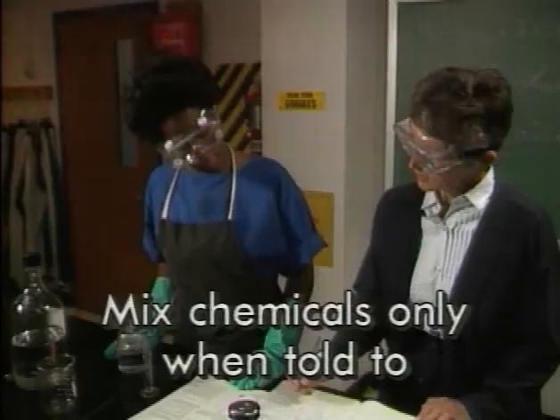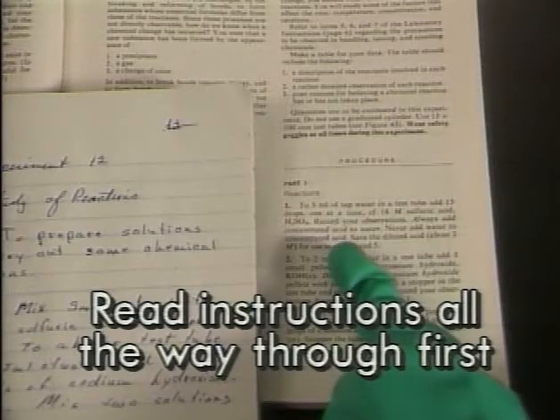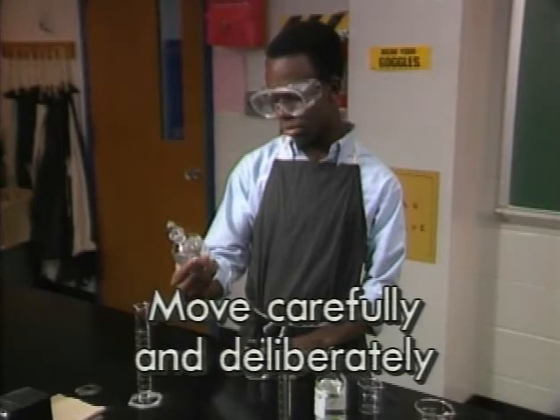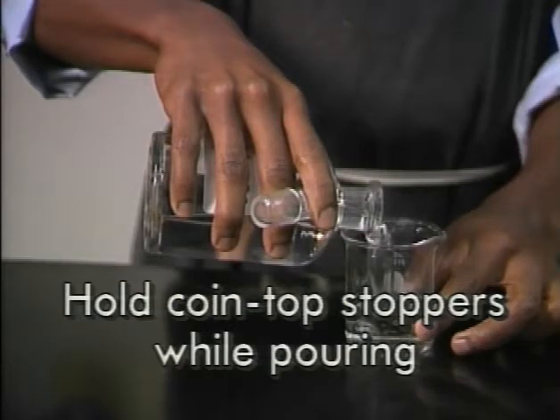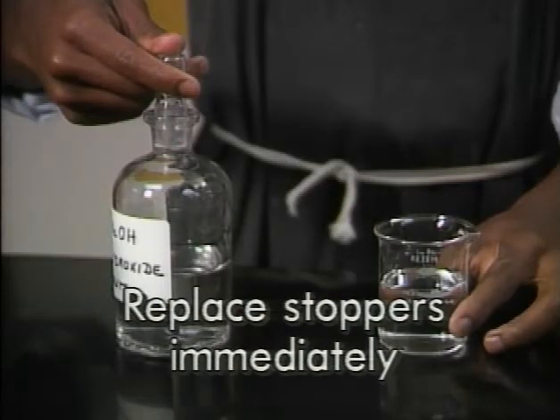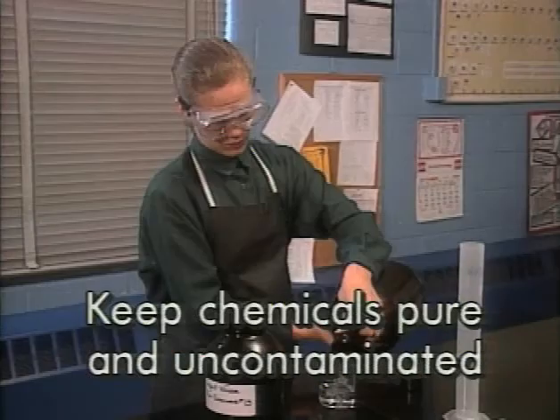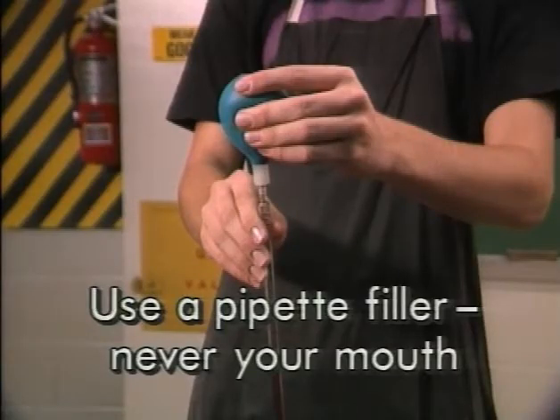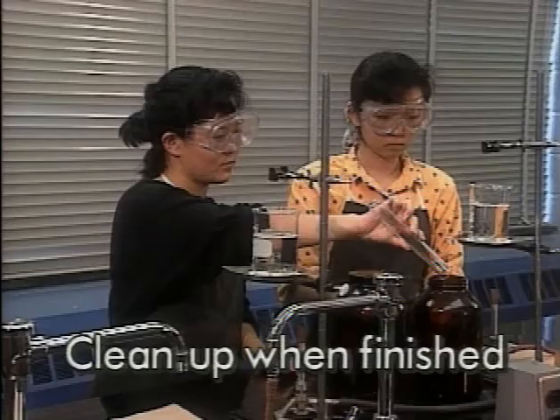Chemical safety summary: work with small containers; mix chemicals only when your teacher says to; read and reread chemical labels; read instructions all the way through first; use a work tray; move carefully when handling chemicals; add concentrated sulfuric or phosphoric acid to water; hold coin-top stoppers between your fingers; hold bottles with your hand over the label; replace stoppers immediately; keep chemicals away from your face; work with harmful volatile chemicals under a hood; keep chemicals pure and uncontaminated; use a pipette filler, never your mouth; notify your teacher to clean up spills; put waste in the proper container; clean up when finished.